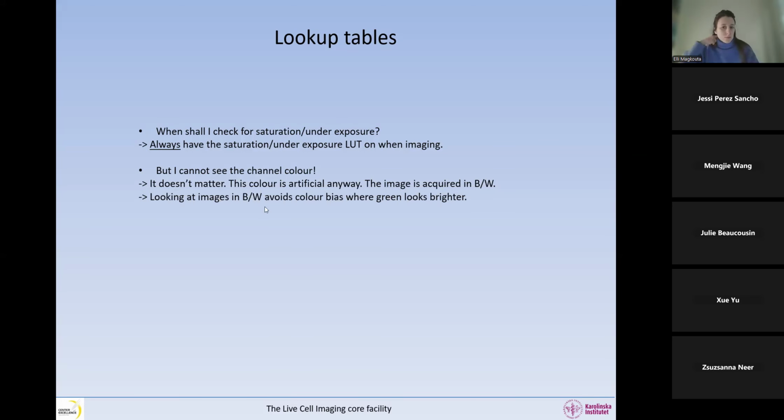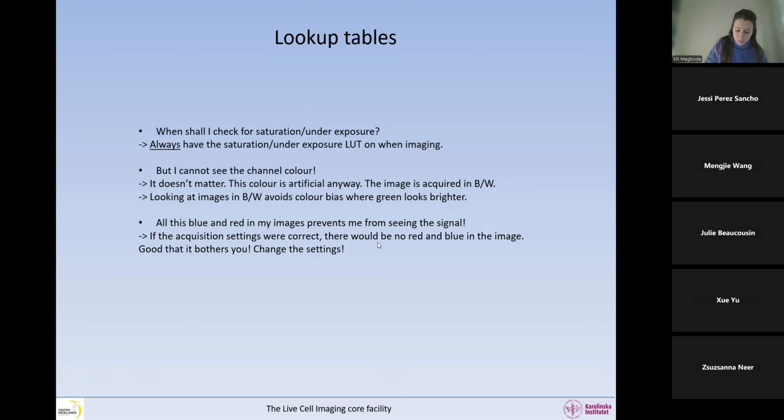And then it's better to look at the images in black and white because that avoids the color bias that we have in our eyes, since we have more photoreceptors in green than in blue and red, so the green looks brighter. So just look at your images in black and white. And then all this blue and red in my image, oh, it prevents me from seeing what I want to see. Well, good. If the acquisition settings were correct, there would be no blue and red in the image. So good that it bothers you, and change the settings. Leave it on and change the settings so you do not have any.